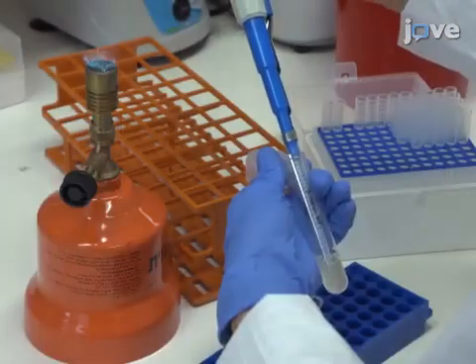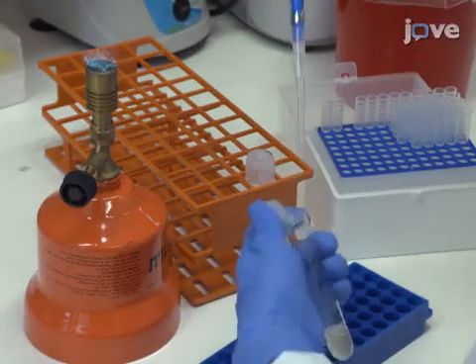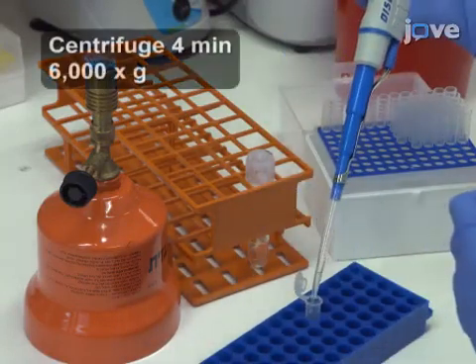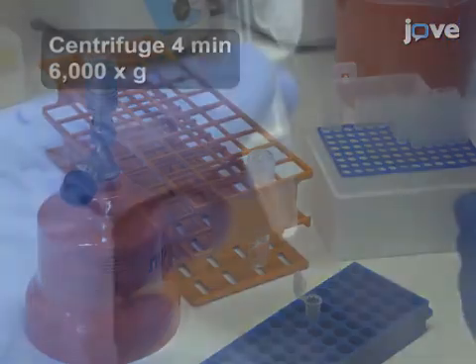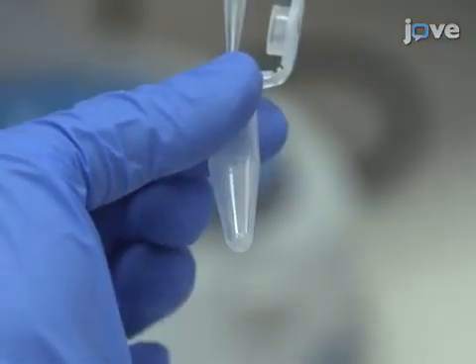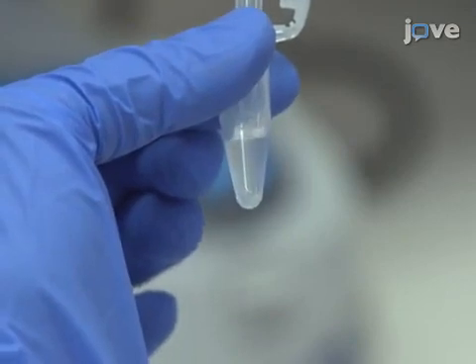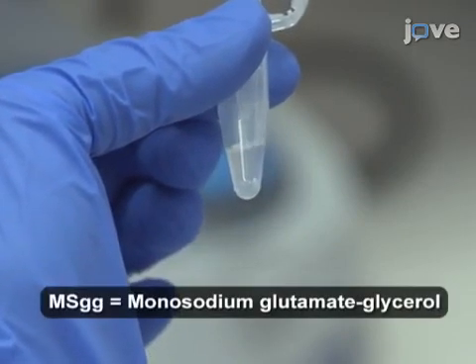After incubation, take 1.5 milliliters of the starter culture and centrifuge for four minutes. Carefully remove the supernatant and then re-suspend the pellet in 1.5 milliliters of MSGG medium.